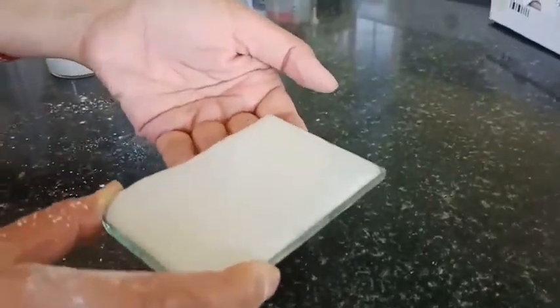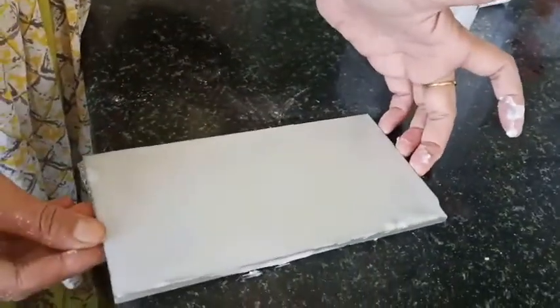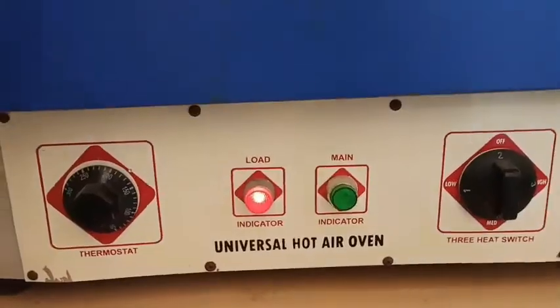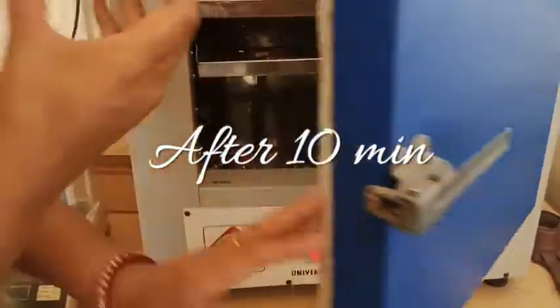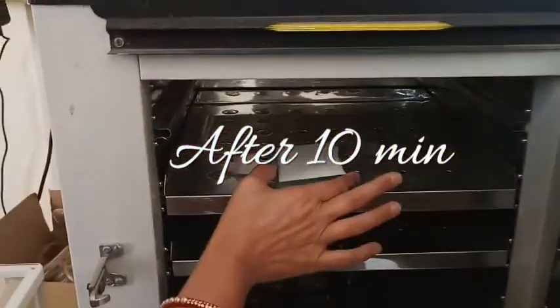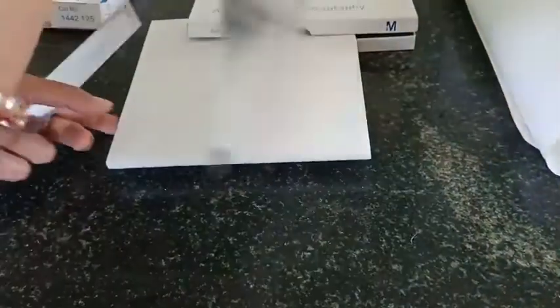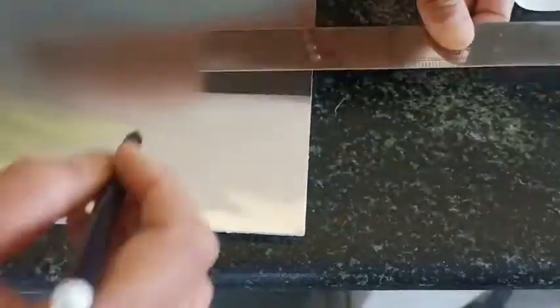Calmly spread it on the glass plate, taking care that no bubbles are present, and then tap it. I have prepared the second plate also. I will keep them for five to ten minutes as such, and then keep these TLC plates inside the preheated oven at 100 degrees for 30 minutes. I'll heat them for half an hour and then leave them to cool.